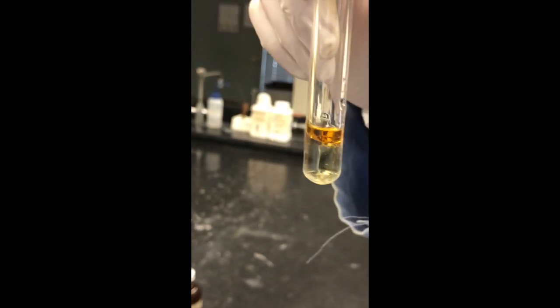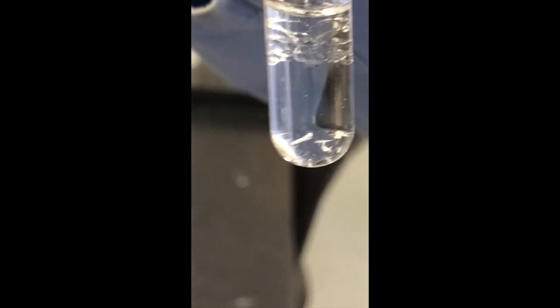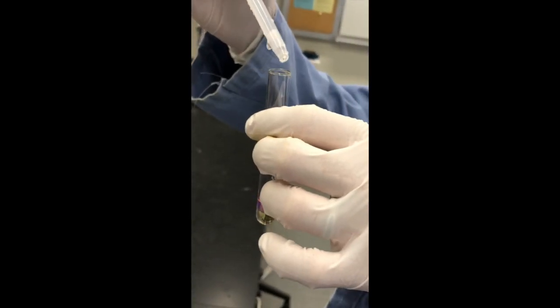We will be adding the anions to the diatomic elements. First, chloride added to each of the elements. Chloride has been added to the solution containing bromine — we check the upper layer to see if the element changed into another element. Next we will add chloride to chlorine, then we will add chloride to iodine. Once we mix that up, we should be able to tell if an upper layer color change took place.